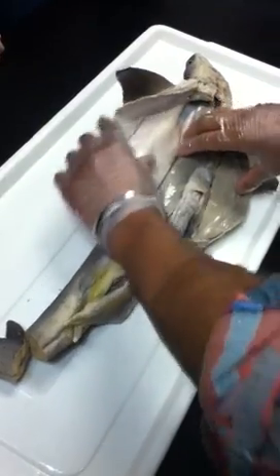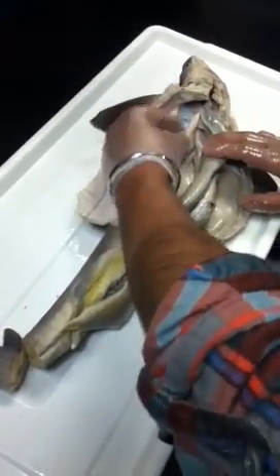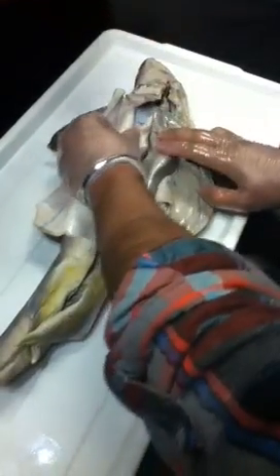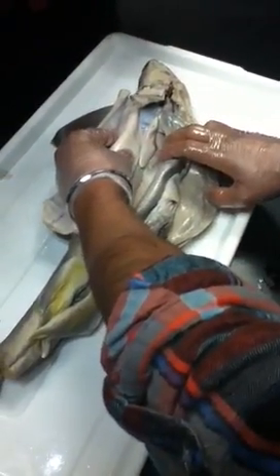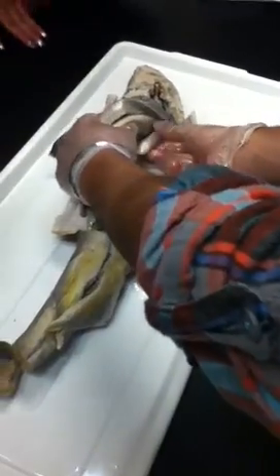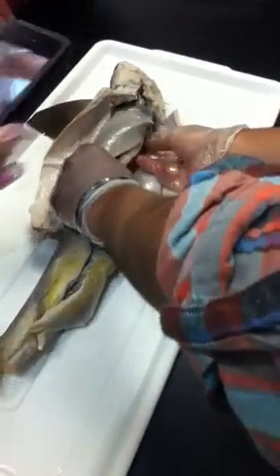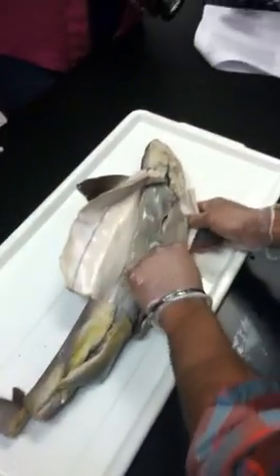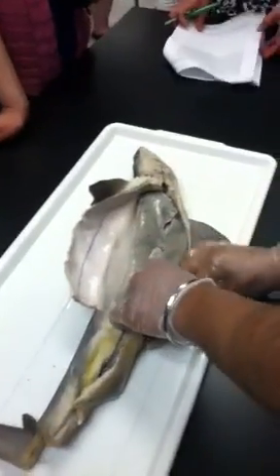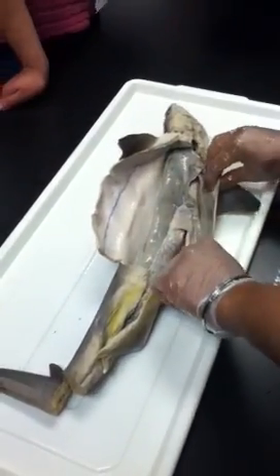And then the gonads. The gonads are right basically below the liver over here. One on this side. Yeah, that's the gonad. Much higher up at the bottom. This one right over here on this side, same thing. Maybe turn it over more. Yeah, there we go. That's the gonad. Would you guys expect to find eggs in there? No. One's a male. No.